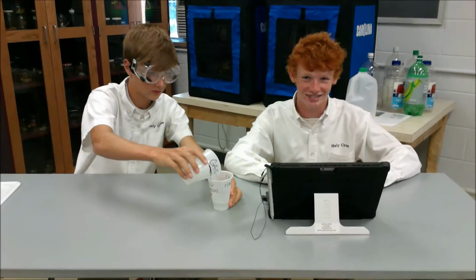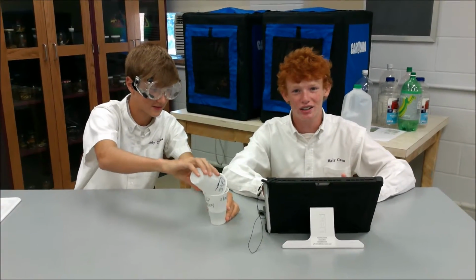Silly Johnny, you're not supposed to get up and distract other people. Thanks, Billy. Now I know to stay on my work.